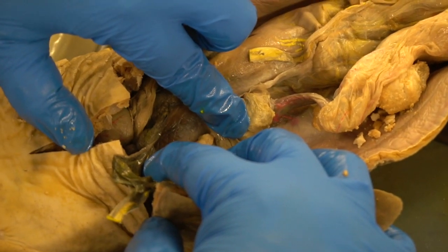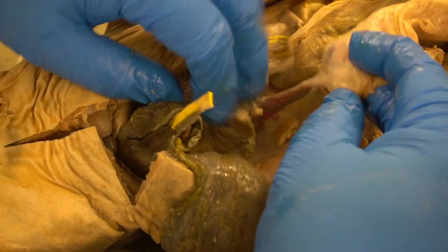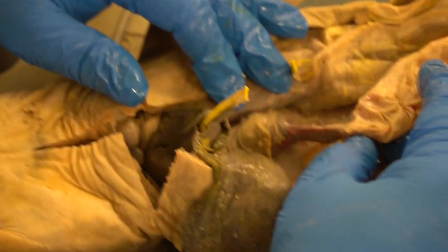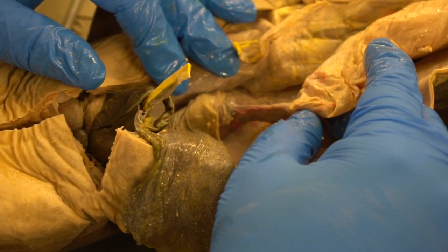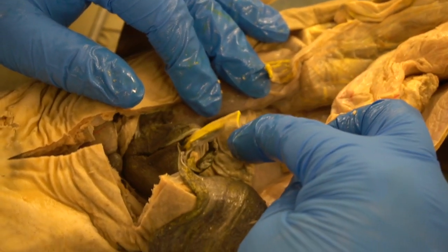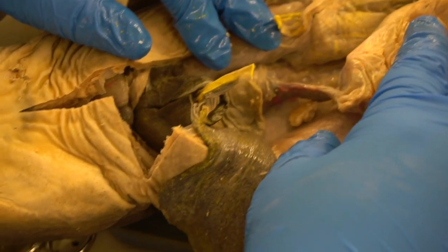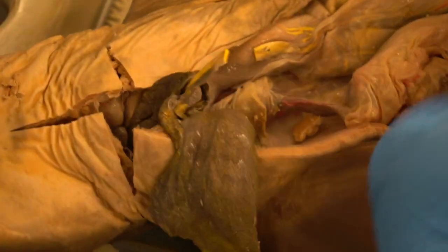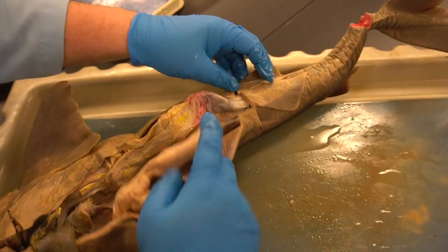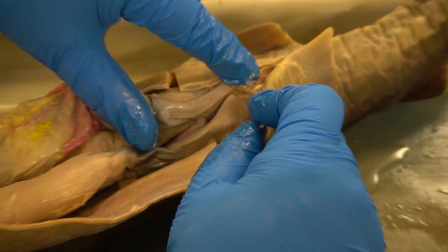Here we have an egg machine. This is going to make eggs. There is a duct attached to that called the oviduct, which will deliver eggs down to the incubation part, which is the uterus. Ladies, you have the same architecture as the shark. You have ovary, oviduct, aka fallopian tube, and uterus. At the end of the uterus would be a vaginal canal, which would empty out and pass into the urogenital opening. See how it connects here? There's the exit of the reproductive system.